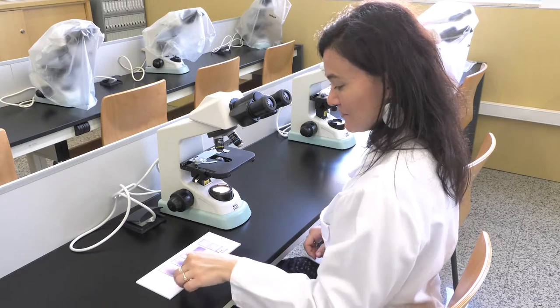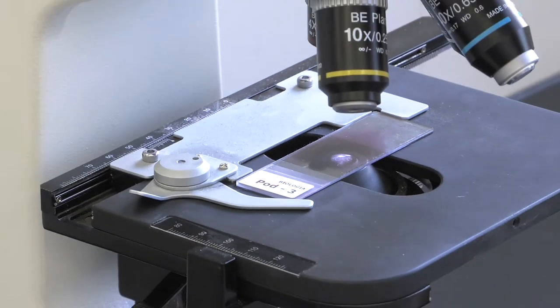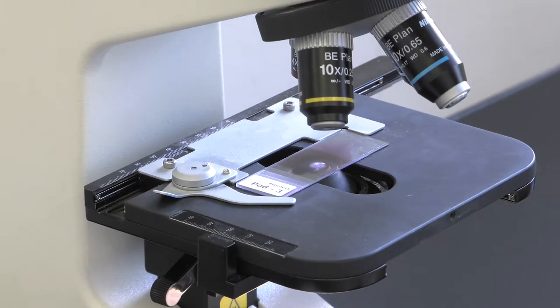To place the preparation on the stage and hold it, we can make use of the specimen holder that has a couple of clamps. When the clamps are closed, the preparation is fixed on the stage.